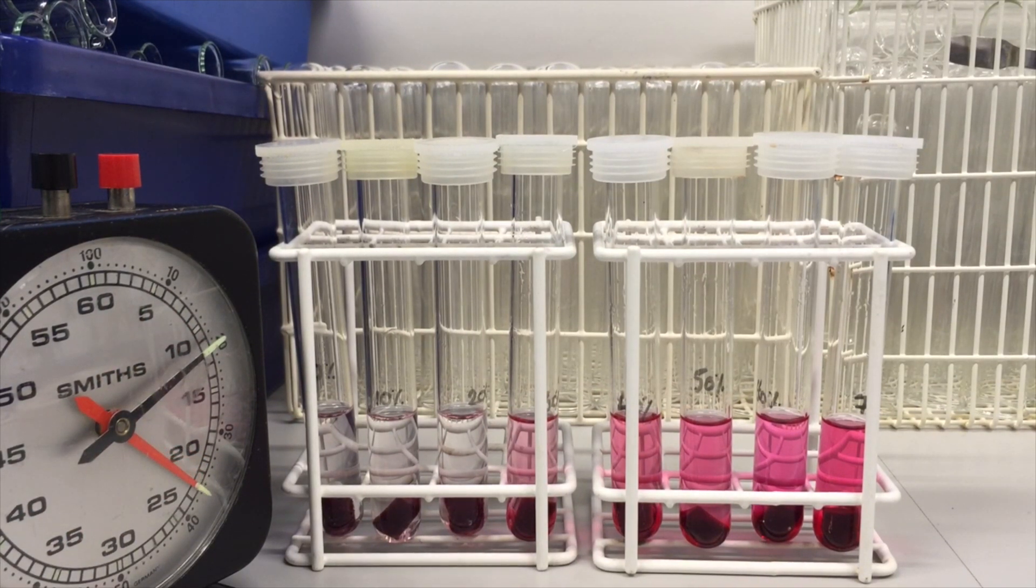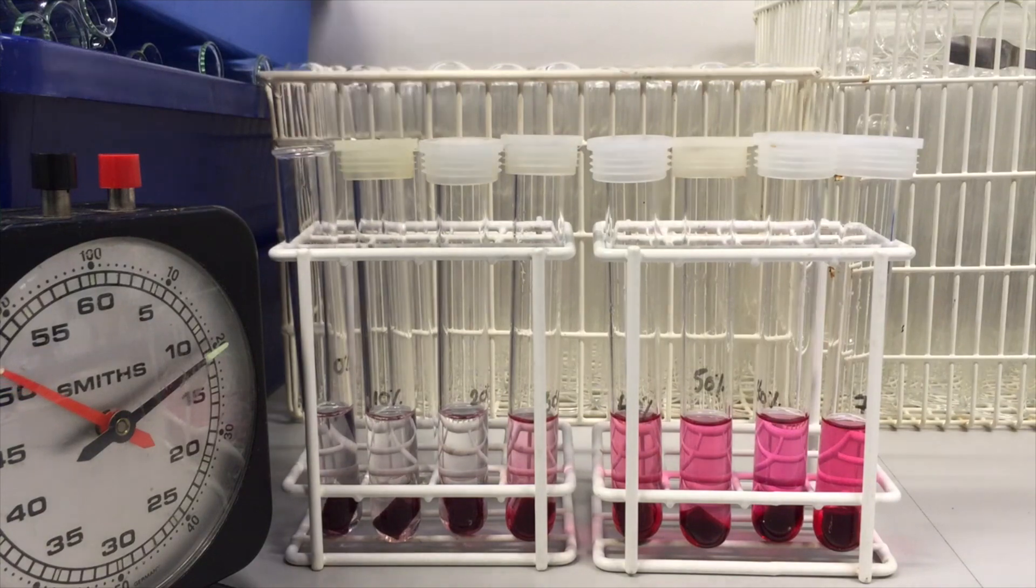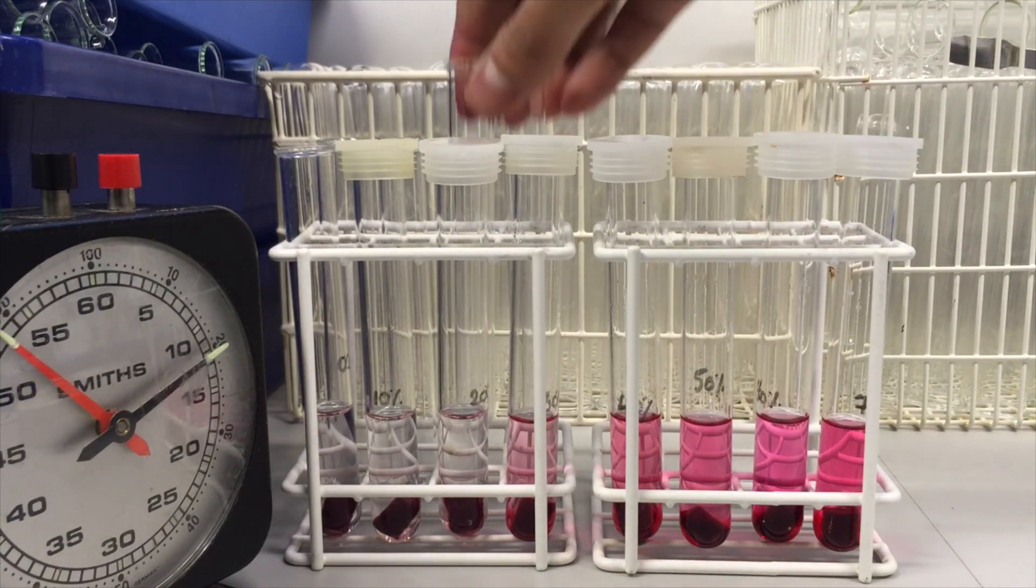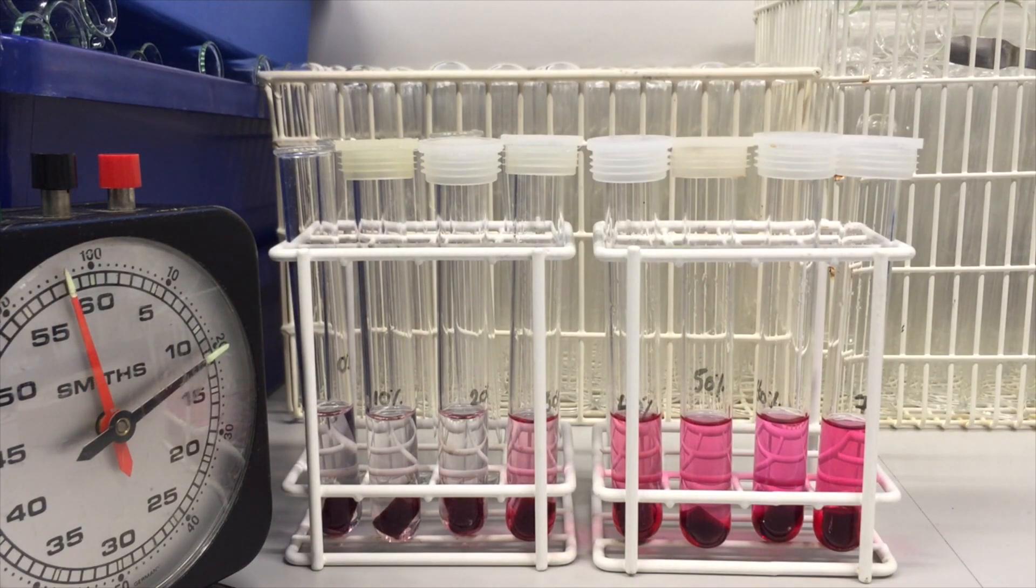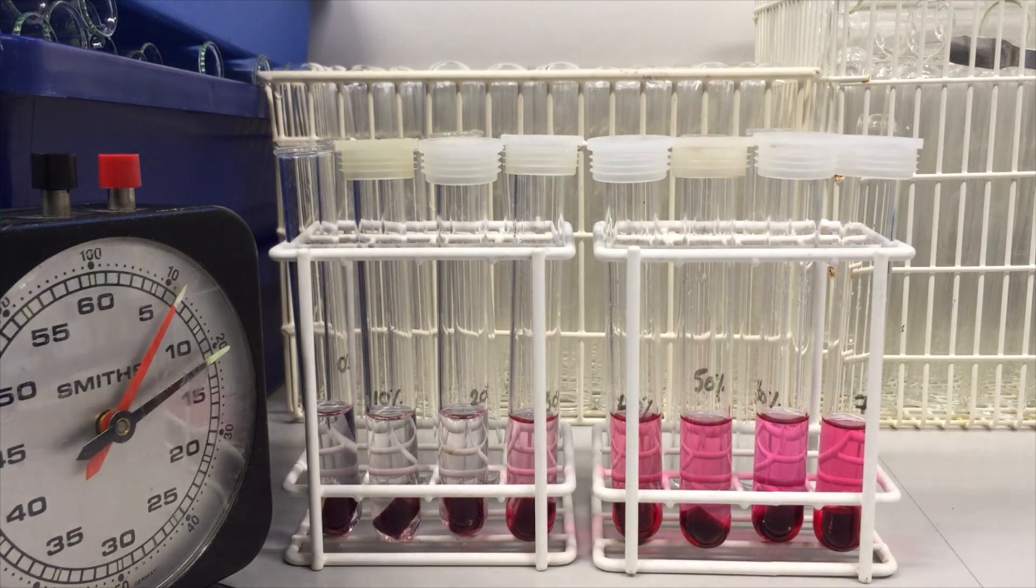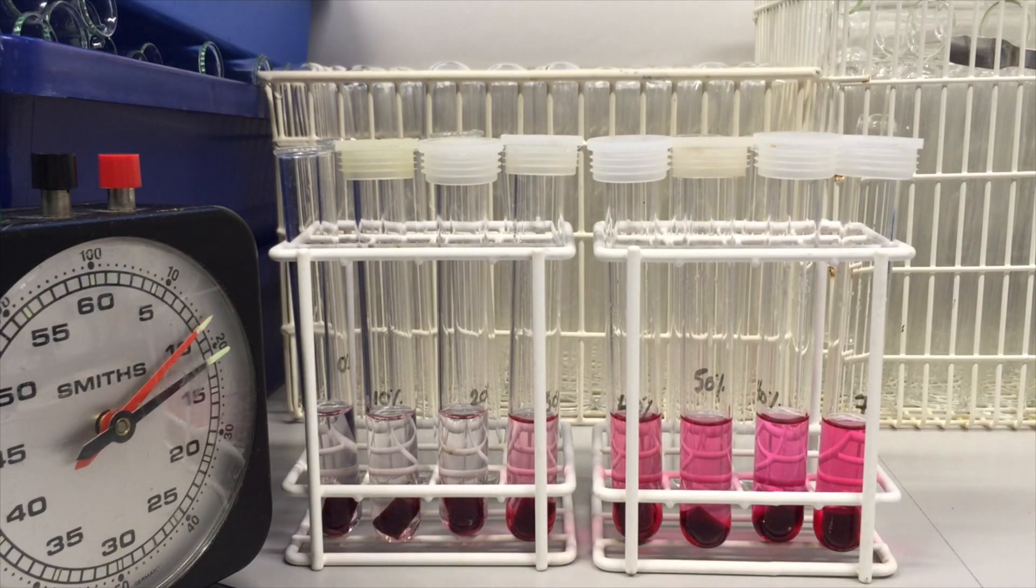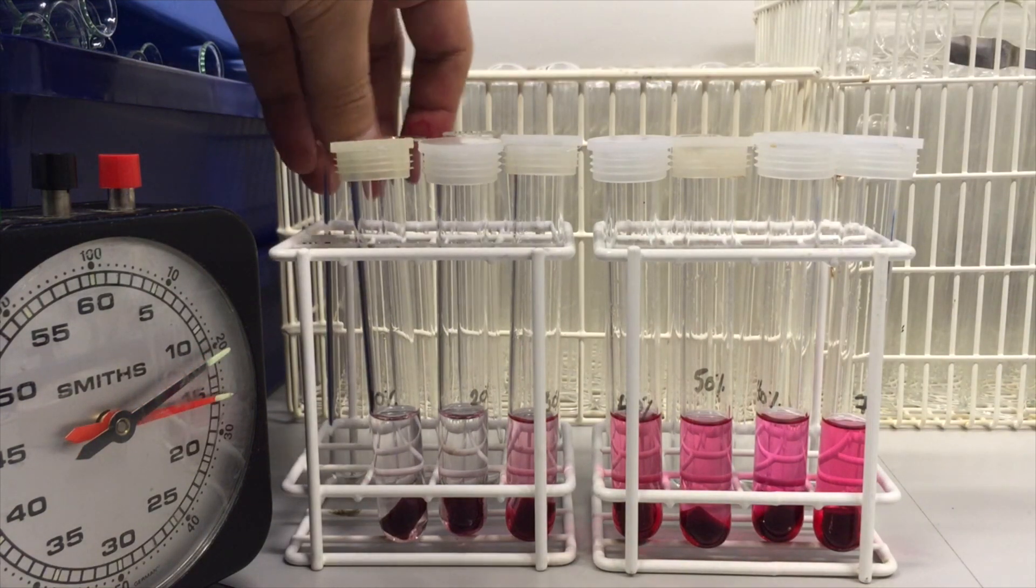Okay, so we'll stop that experiment there. The way we could do that is just by decanting the liquid from each tube into a separate tube, and leaving the beetroot piece there.